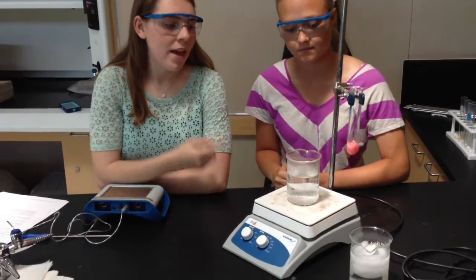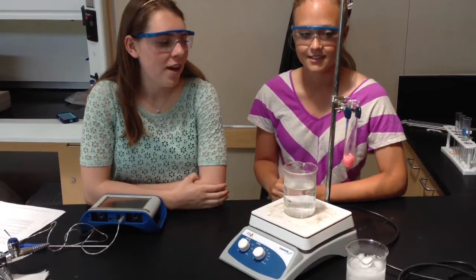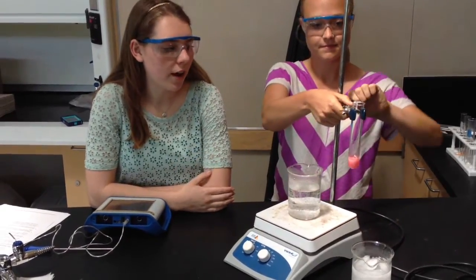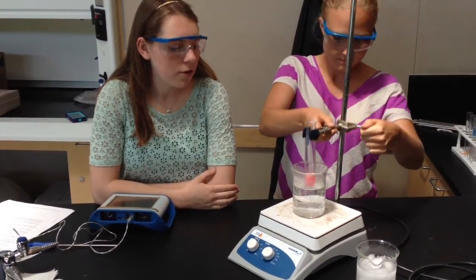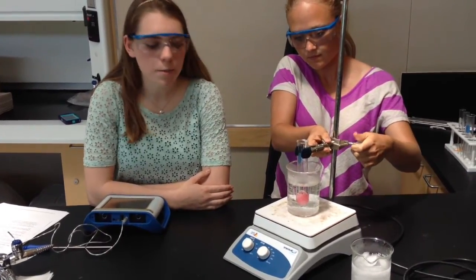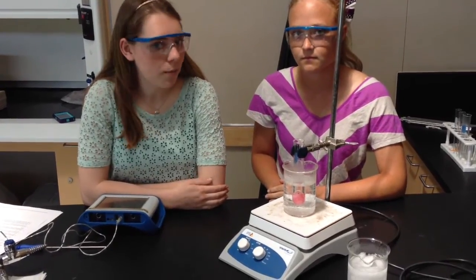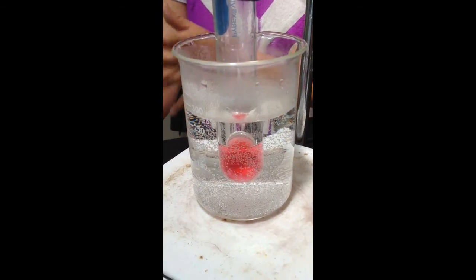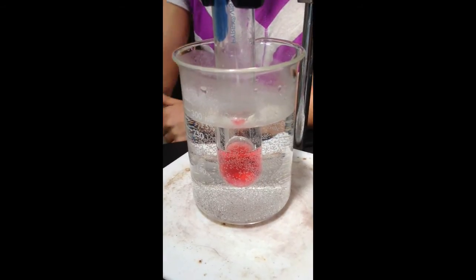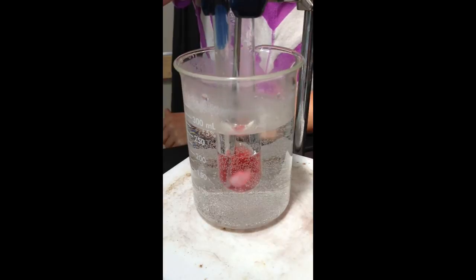This is what your lab setup should look like. You have a hot water bath, and you have the lauric acid with the unknown solute dissolved in it, and you're going to want to melt the lauric acid as your first step. So place it in the hot water bath using the clamp so it doesn't touch the sides of the beaker, and wait until it melts. You're just going to want to keep an eye on it. You don't need the temperature probe yet. Also, if it's taking a while to melt, you can always use your temp probe to stir it a little bit so it'll go a little faster.